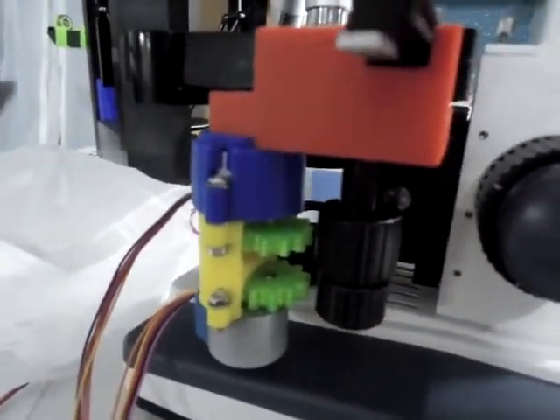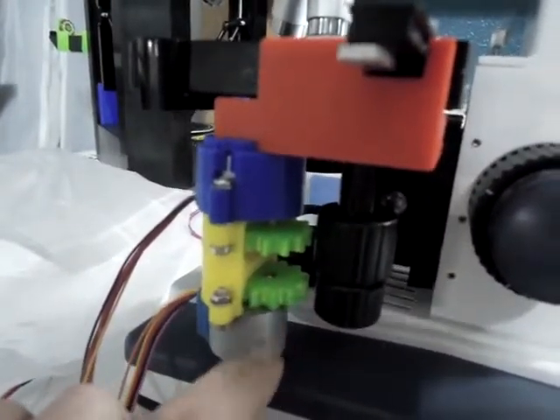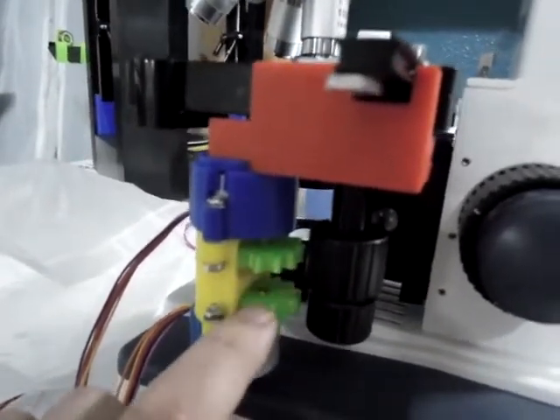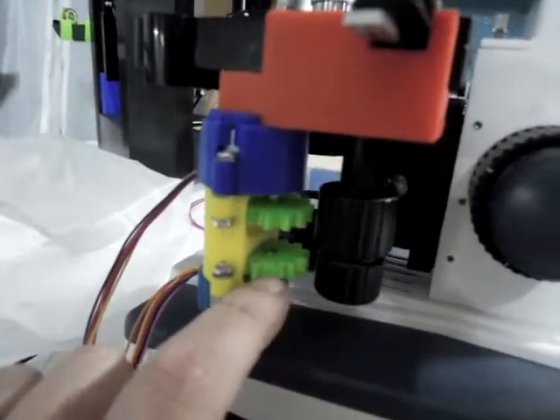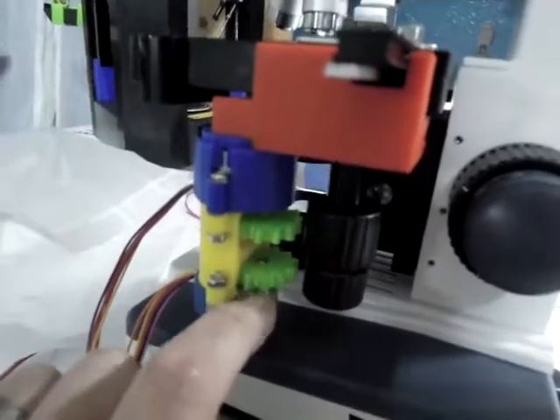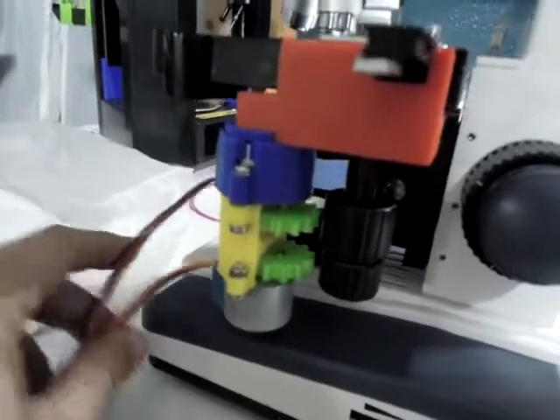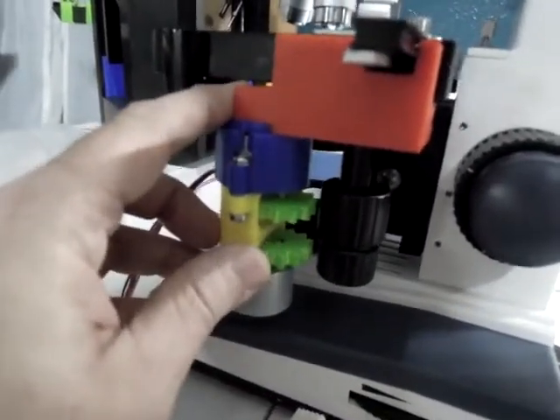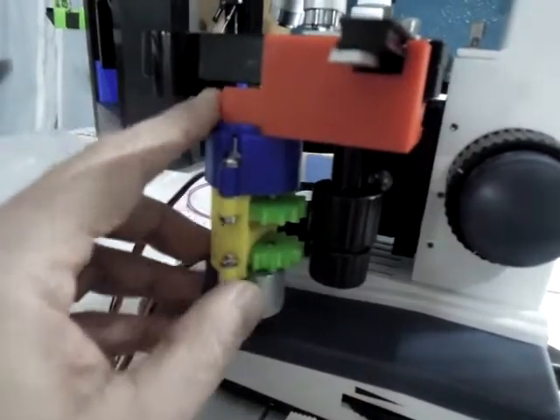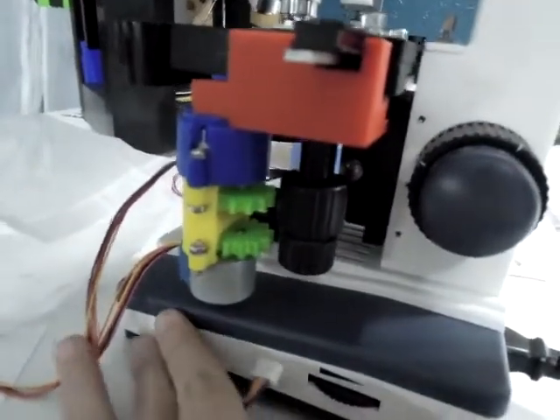So I've got to redesign, probably in OpenSCAD, gears for the X and Y knobs. While I'm at it, I'm probably going to redo these green gears that get press fit into the stepper motors — I'd rather have a slightly finer gear than these. This was a really pleasant surprise. It's much cleaner than the design I came up with, and it doesn't use belts — it's direct drive — so we'll see how much torque it has. I'm really excited about that one.